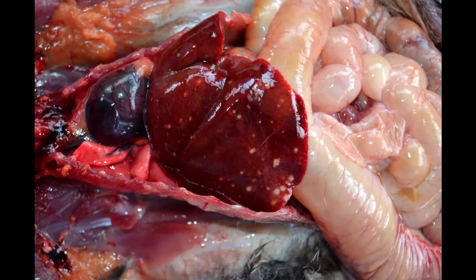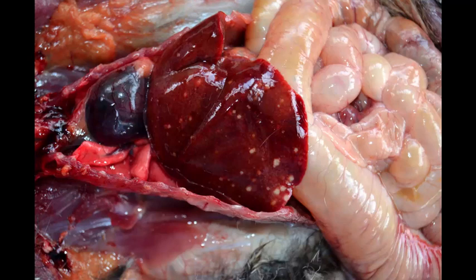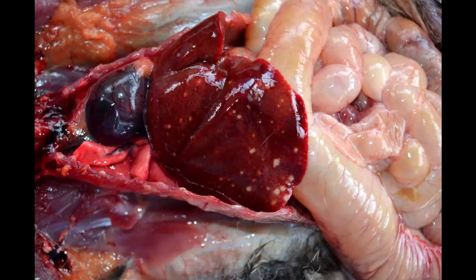The morphologic diagnosis is not too difficult. We have little white dots in the liver — these are areas of necrosis, variably sized, or they may be small abscesses. I'm going to say multifocal necrotizing hepatitis, or multifocal hepatic abscesses — I'll give you full credit. How about multifocal embolic suppurative hepatitis? Same thing — you've got all the words there.